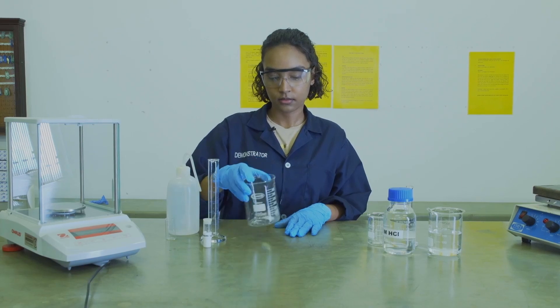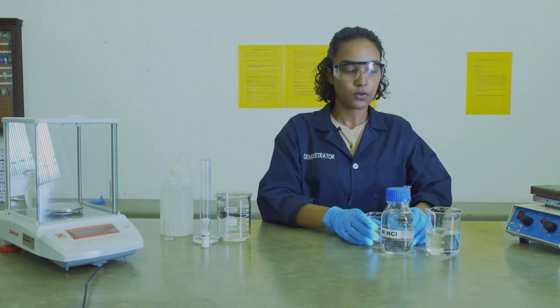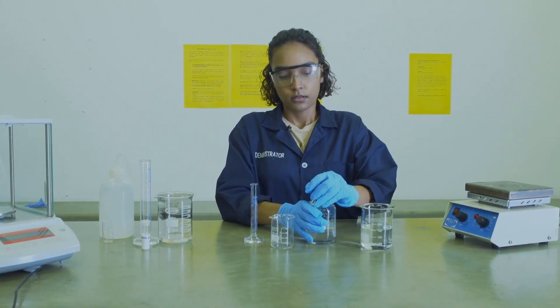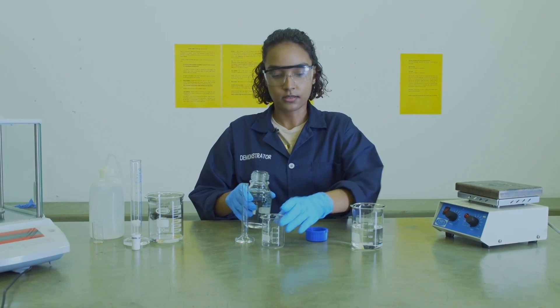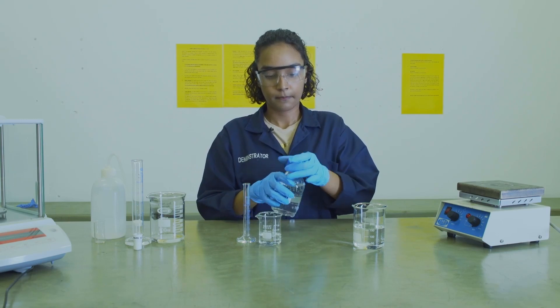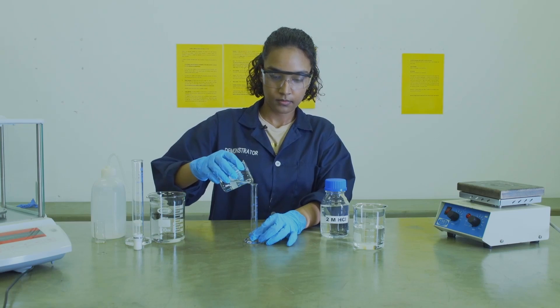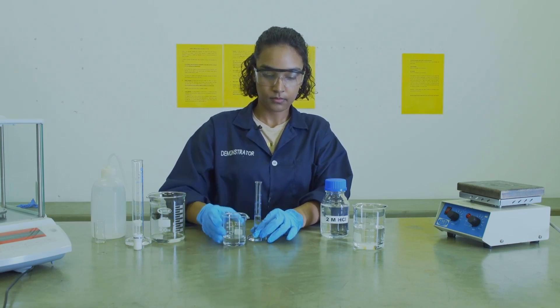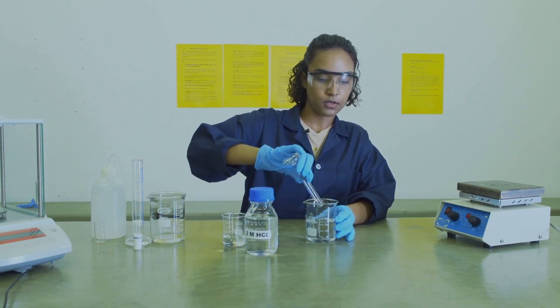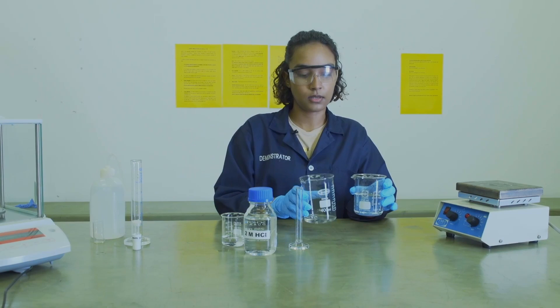Once that is done, you can set it aside and then move over to add six ml of your hydrochloric acid and dissolve it in distilled water. To make it easier to transfer, we are going to add the acid to a beaker and then to our measuring cylinder. We then add this to our distilled water in another 400 ml beaker, and thereafter the contents of this beaker will be added to the beaker containing our epsom salt sample.